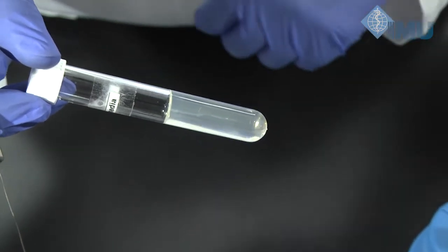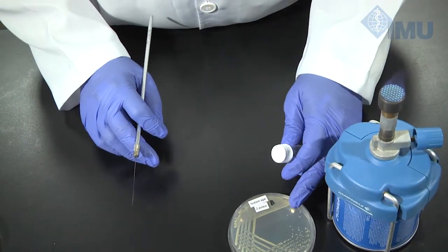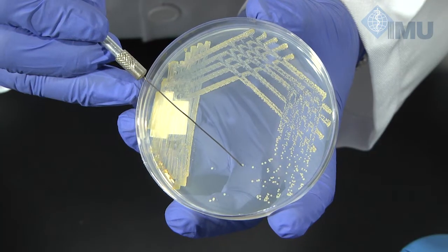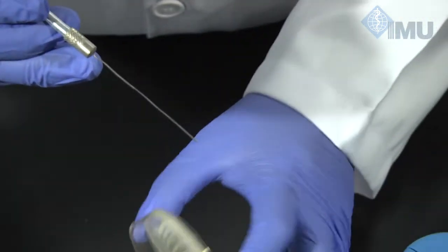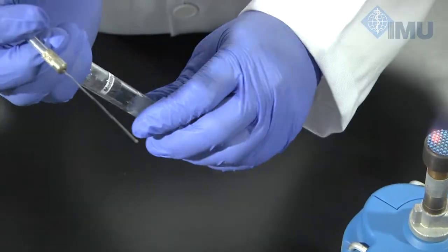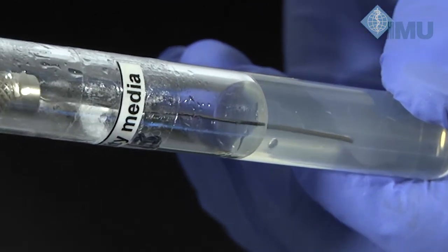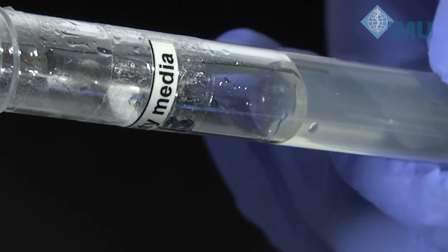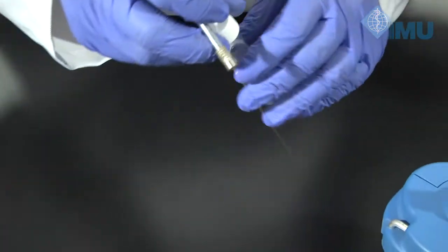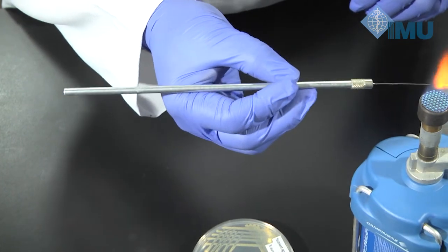In the same way, we pick the colony from plate B, the Staphylococcus aureus. The bacteria is picked and inoculated into tube B by stabbing it in — leave the bacteria there and come out. Both tubes are now done and need to be incubated overnight, after which we will observe the results the next day.